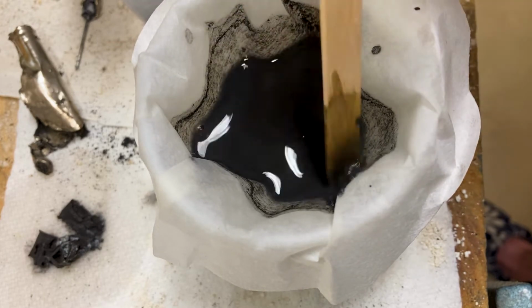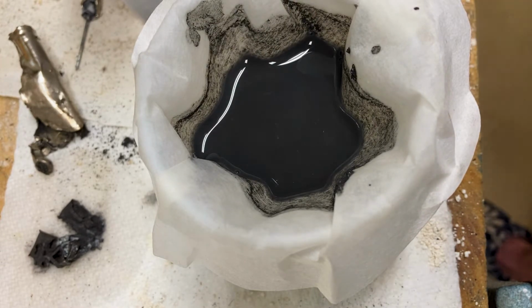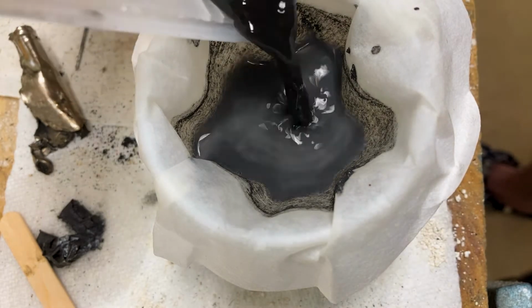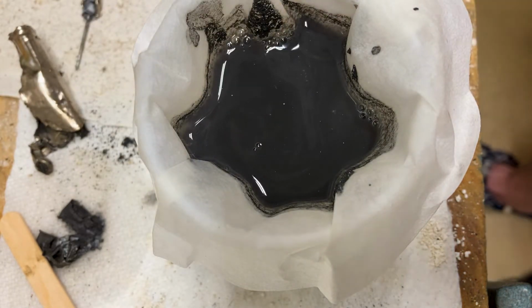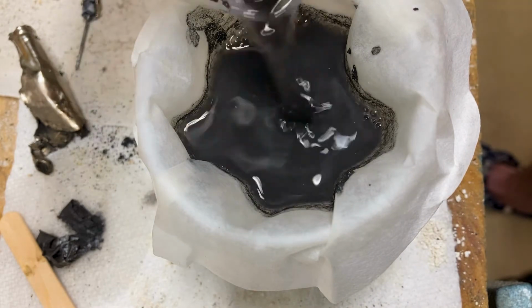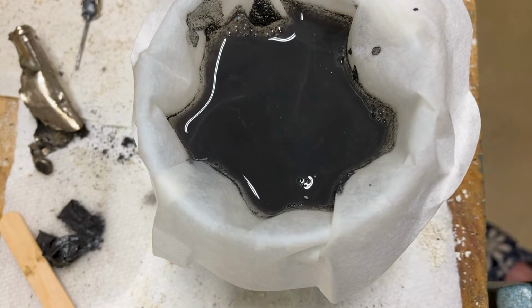So I'll just let this stuff settle down there a little bit. I'll wash out that container with a little more distilled water just to clean it up and get rid of as much of the stuff in there as I can. Just a little bit more, and then we will wait.